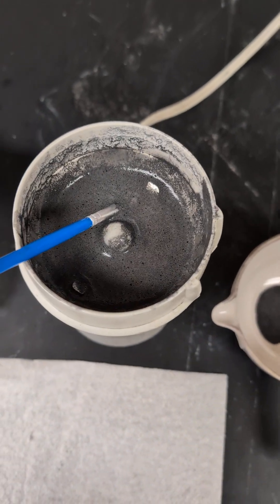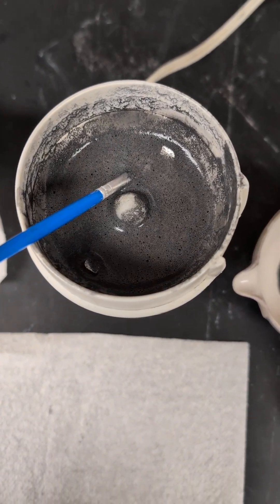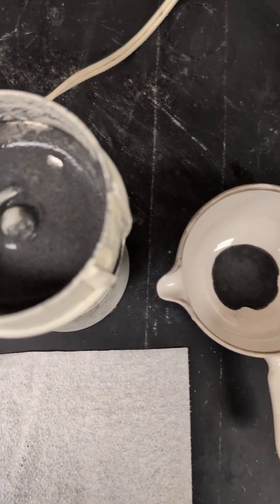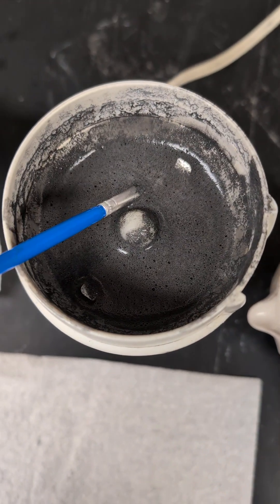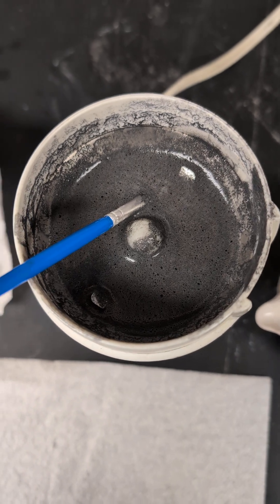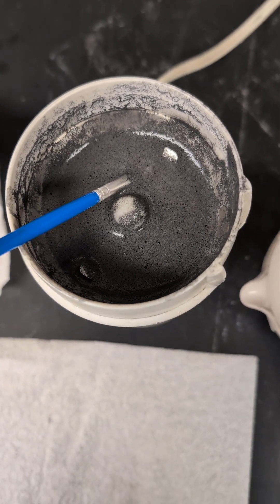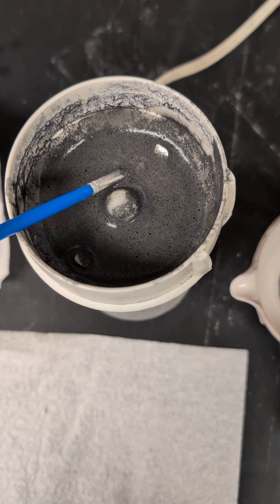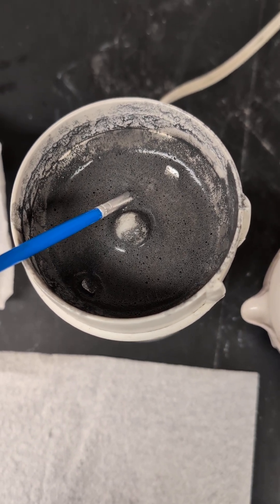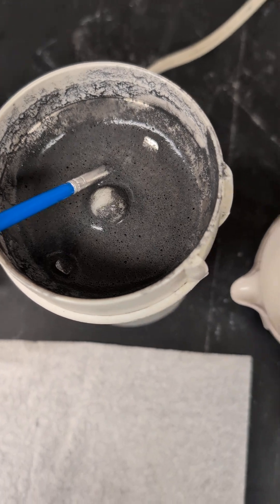We make composite graphite felt composites. One sample has been oxidized first for better adherence for various composites. We will then be placing a sample that's oxidized with a polypyrrole deposition electrochemically, followed by deposition of a composite of interest to us.